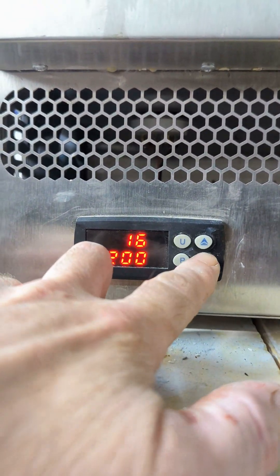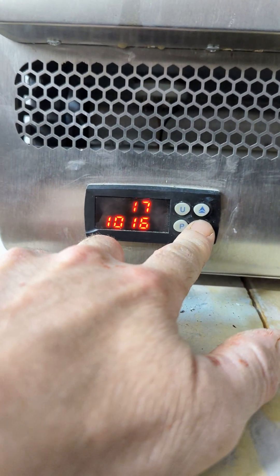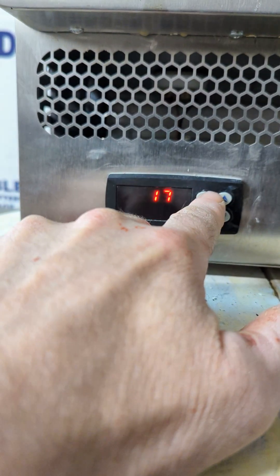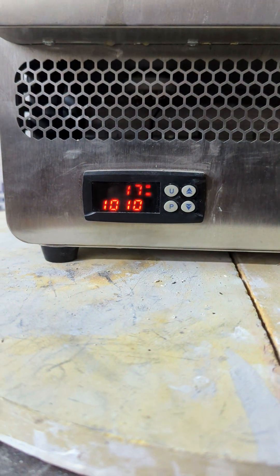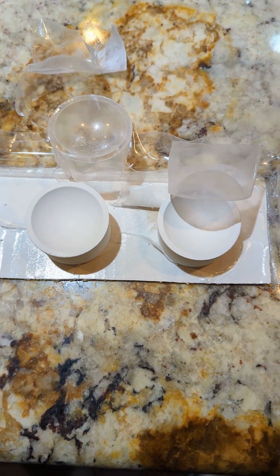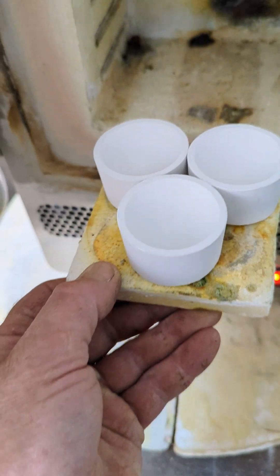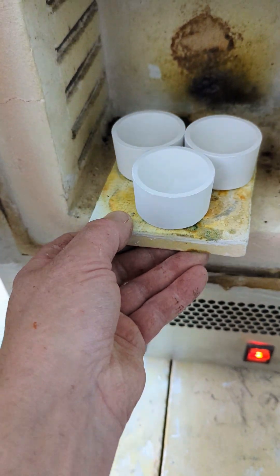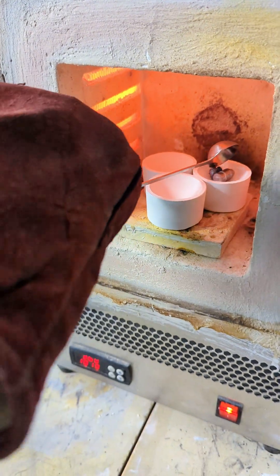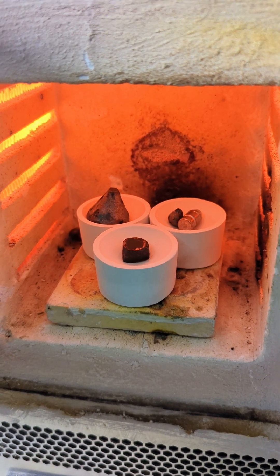Controlling it down here. Adjusting and parking it right there — that should be ready shortly. The cupells are unwrapped. I need to go preheat these as well before loading each prill in each dish. Carefully loading the kiln to preheat these dishes. I'll load it up. Hopefully I'll have some shiny buttons once completed.